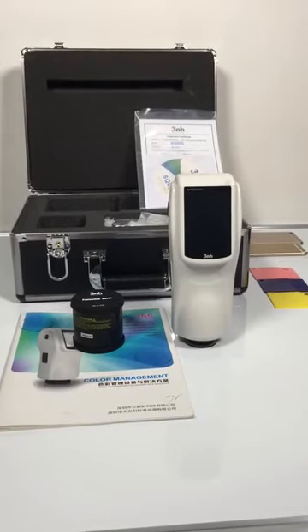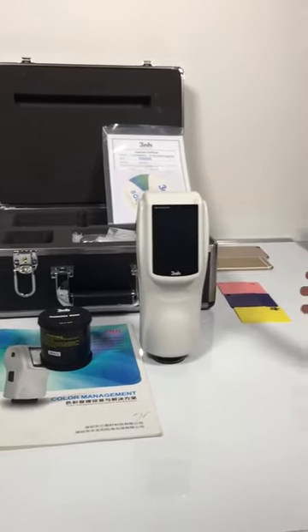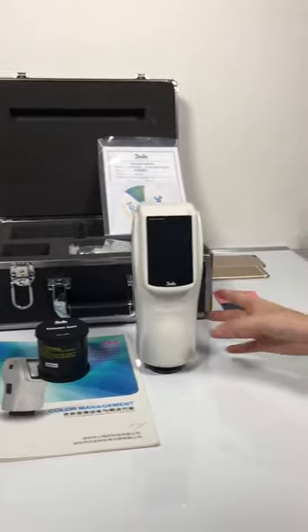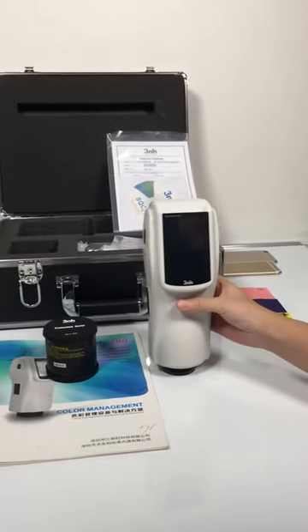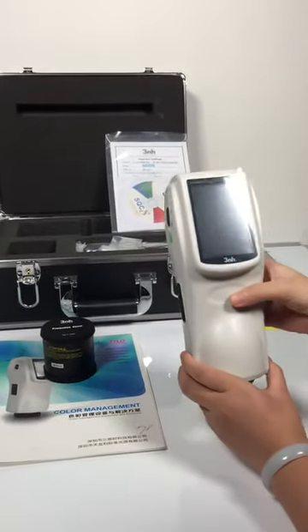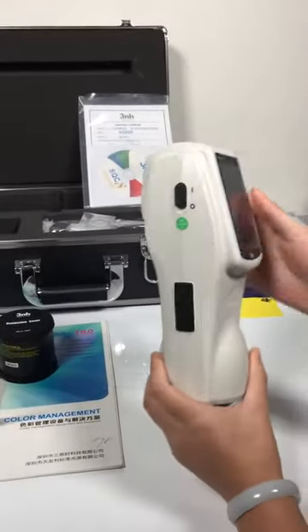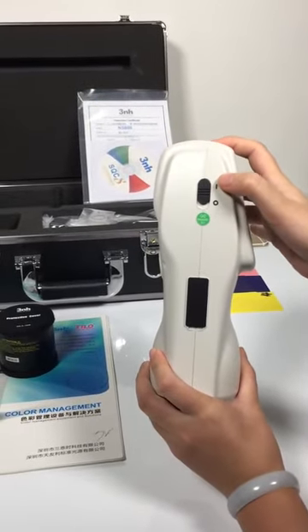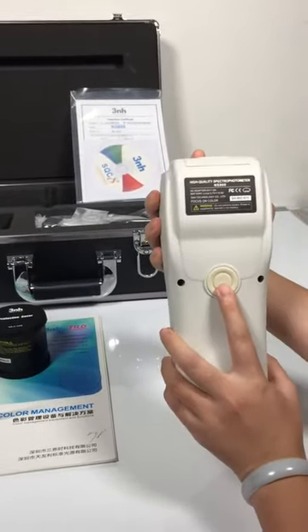Hello, welcome to the operation of NS800 model. This is the spectrophotometer, and this is the switch button and this is the test key.